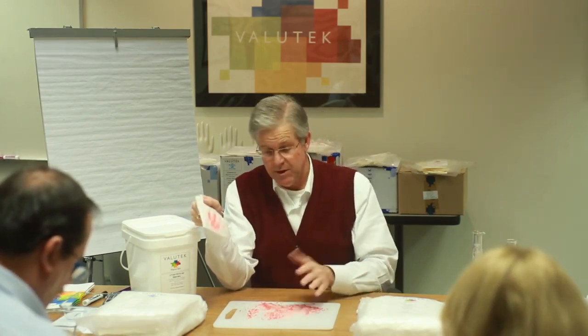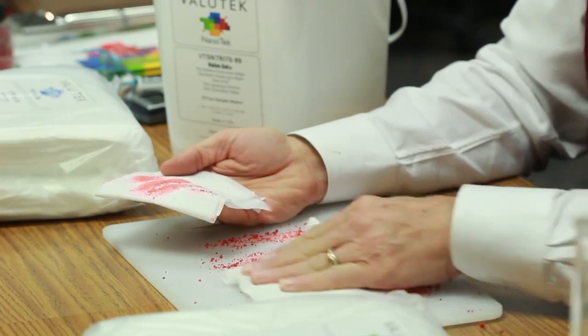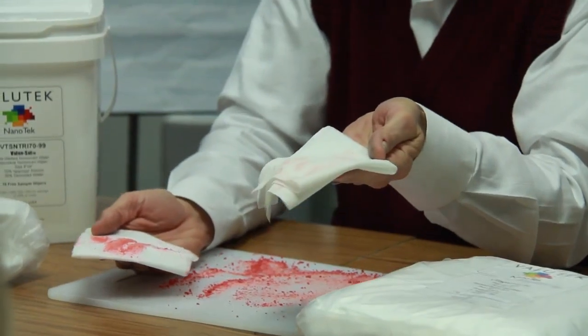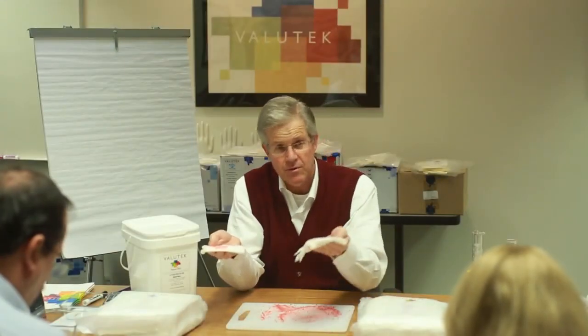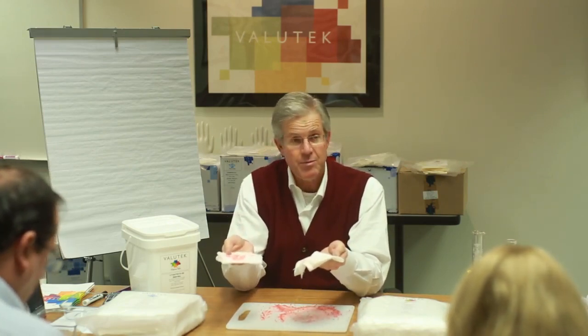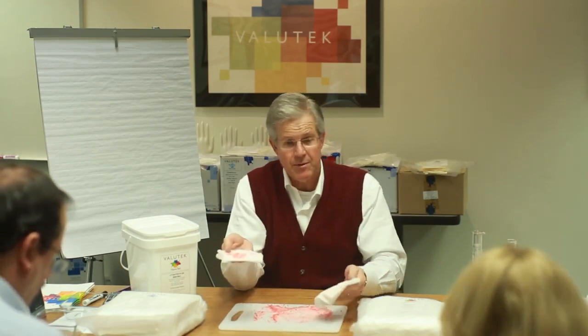Now this was just for illustration purposes. In a real clean room, you wouldn't have particles this large. But the reason why I use the large particles is just to illustrate that a dry wipe really just moves the particles around, and very few particles cling to the wiper substrate. You really need a pre-wetted wiper, or you need to buy a dry wipe that you wet in-house, or you need to order a wiper that's pre-wetted that's going to have the PAT, particle attraction technology. In this pre-wetted wiper, the particles will cling to and stay captured in the wiper substrate.